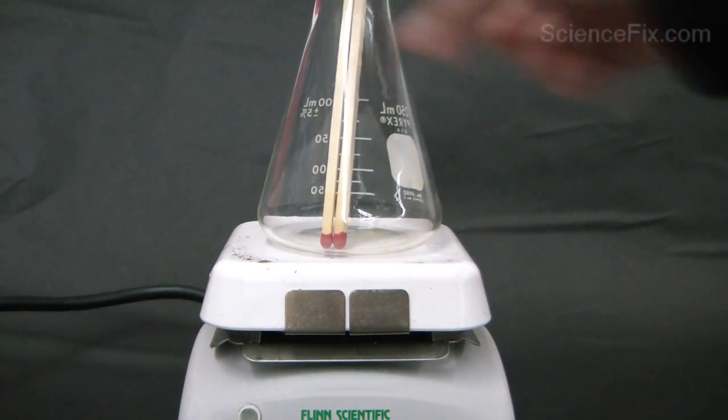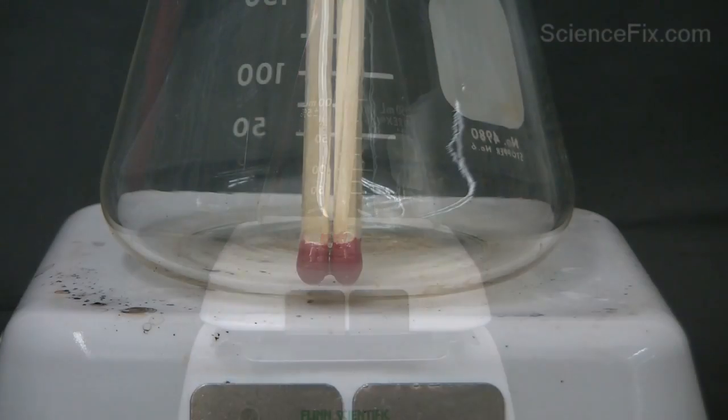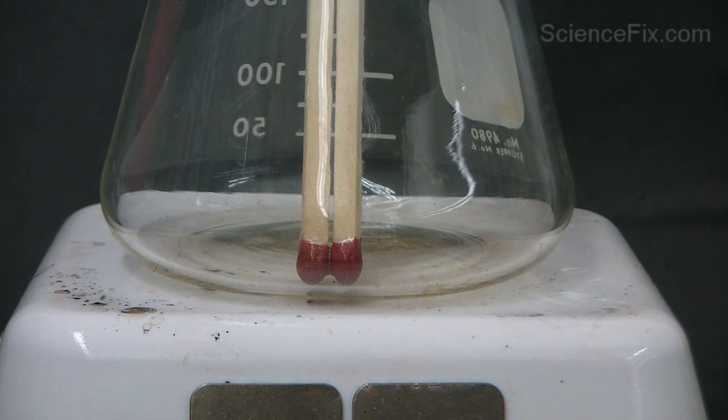In the flask are two large matches. It's being set on the hot plate and the hot plate is turned on high.